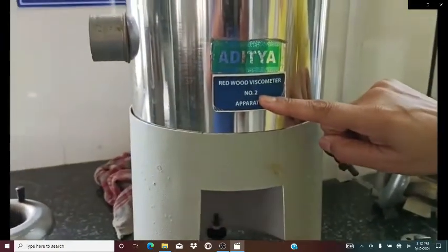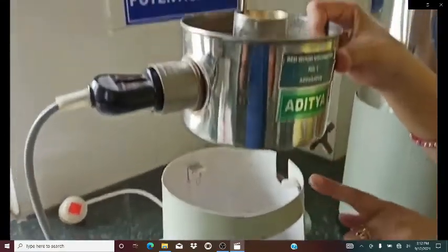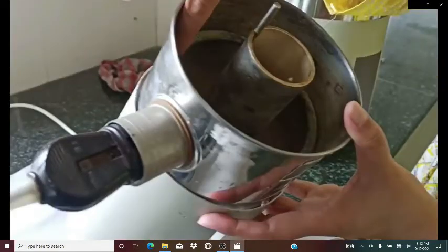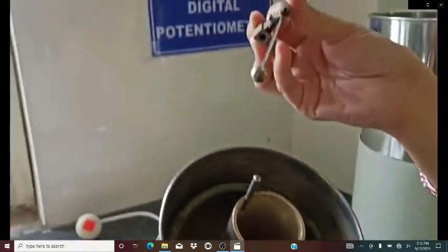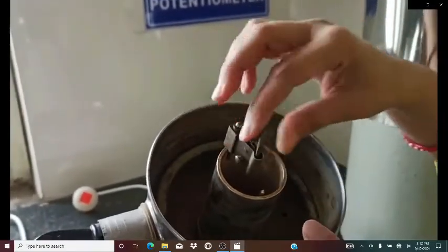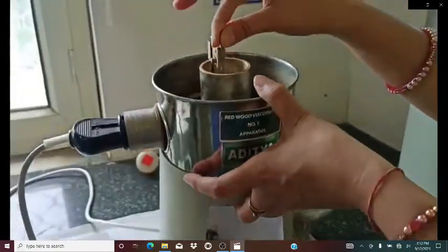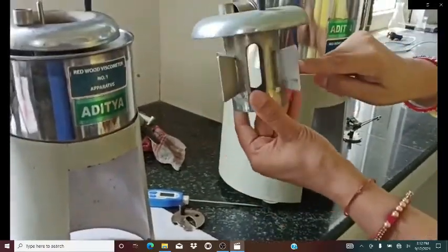This is Redwood Viscometer Number Two. The difference between Number One and Number Two is the nozzle at the bottom — in Redwood Viscometer Number One it is a bit smaller than in Number Two. Here is the rod used to heat up the water, and this is the cylindrical vessel with the nozzle at the bottom. This apparatus is used to block the flow at the bottom so that the lubricant does not flow out. Here is the lid and the mechanical stirrer.